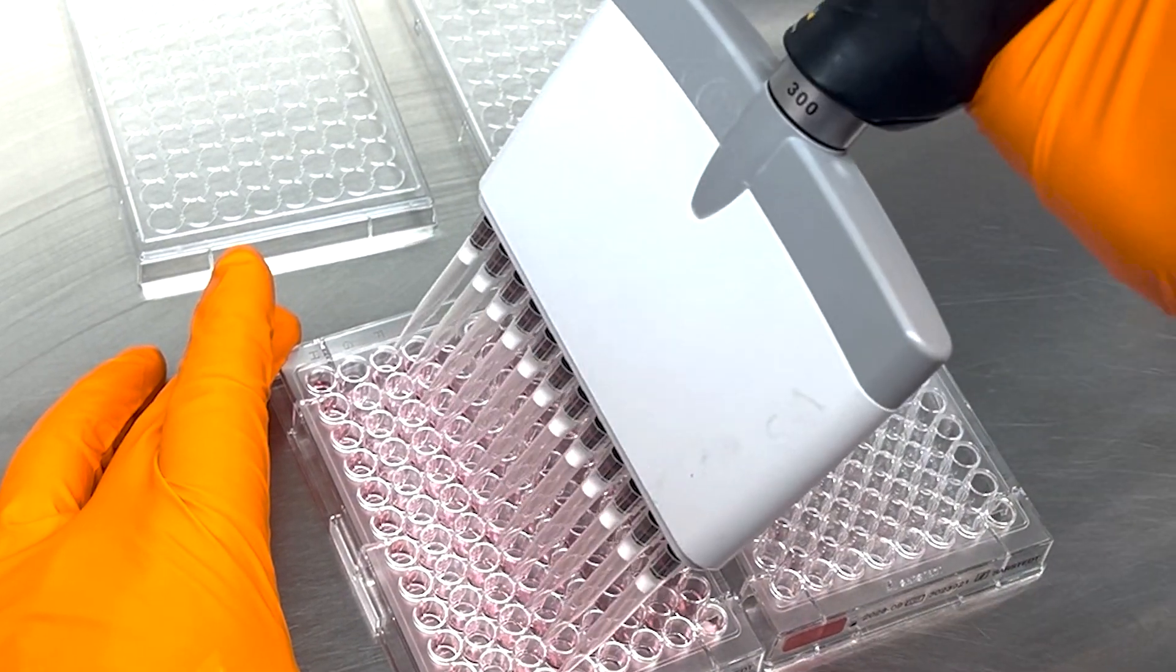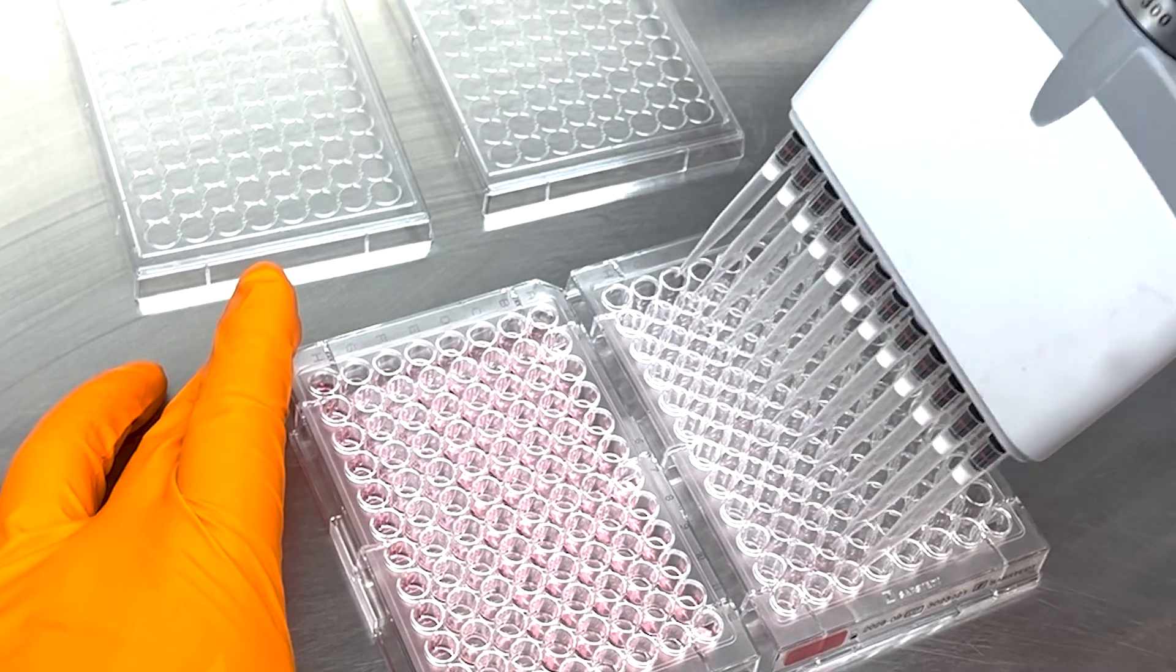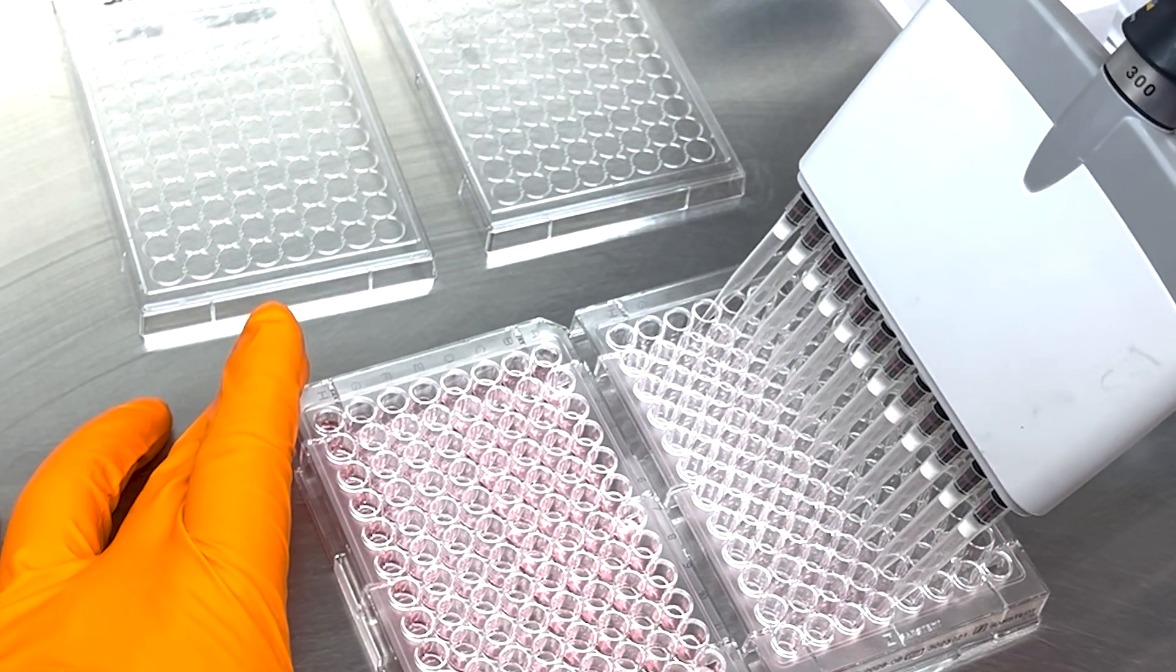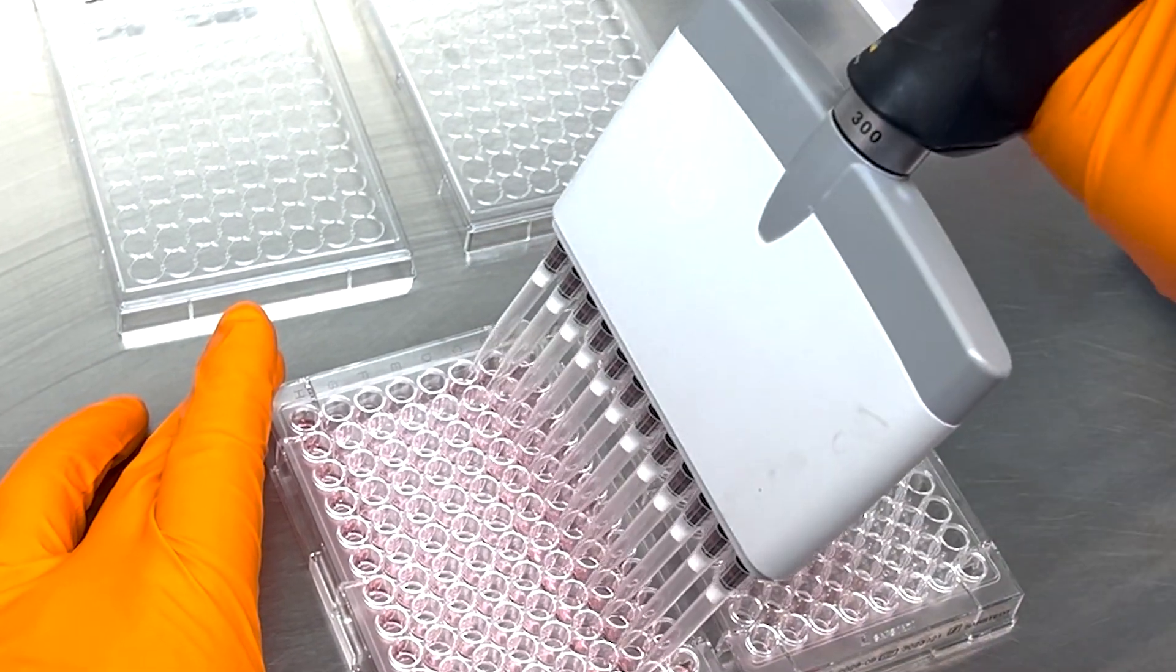After this, we return the plate to the incubator to allow the virus time to replicate. When we see that the cells are clearly infected, a timing that varies depending on the virus we're working with, it's time to wrap up the assay.